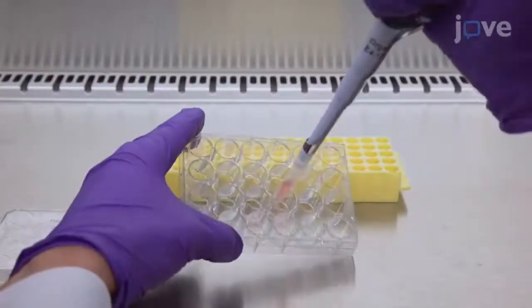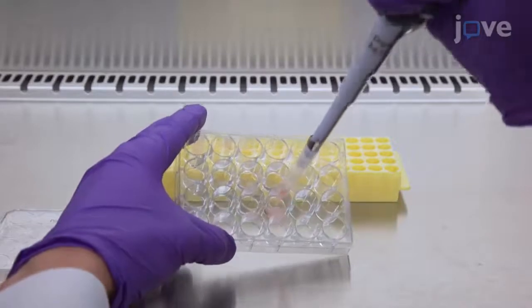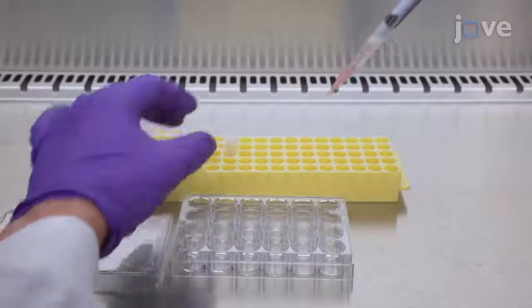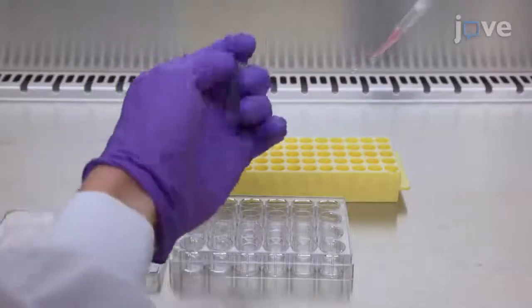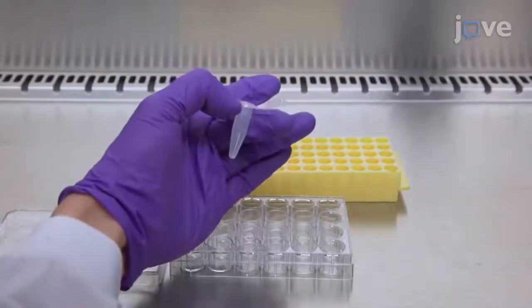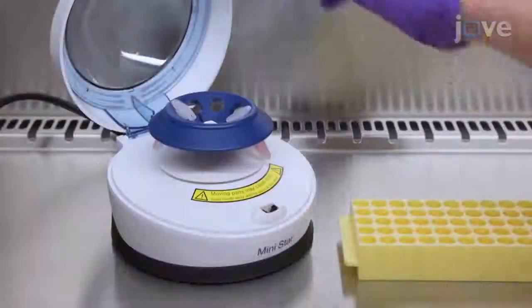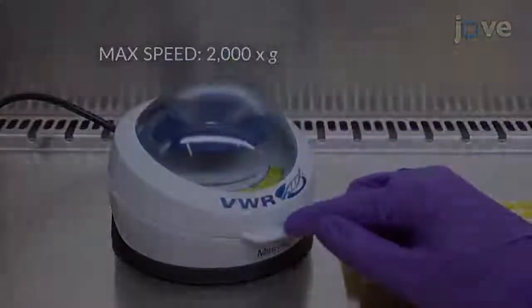Repeat this procedure with the same medium in the next well as required, but do not harvest more than 2 wells per 500 microliters of basal medium. Collect the organoids in a low-binding 1.5 ml microcentrifuge tube and spin them down in a mini tabletop centrifuge for 15 to 20 seconds.